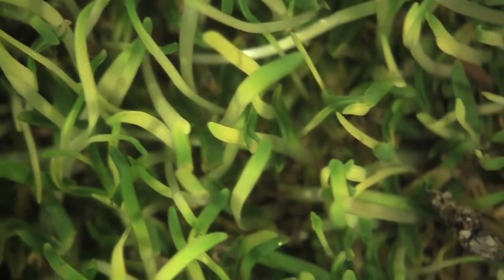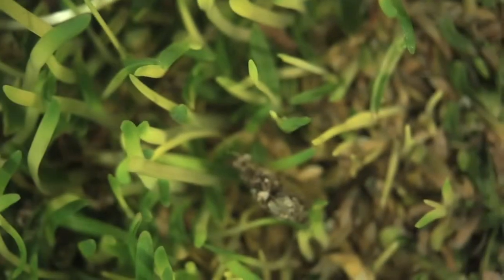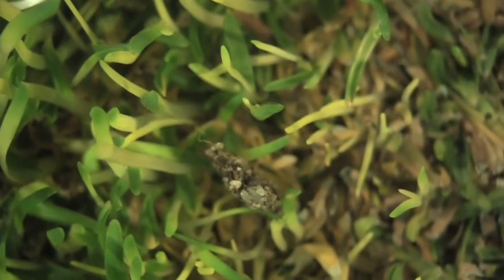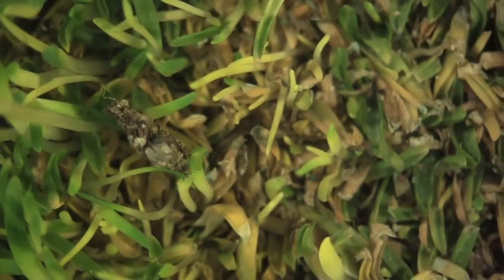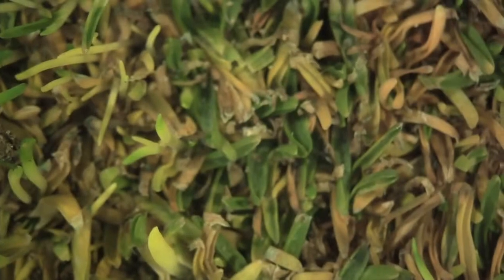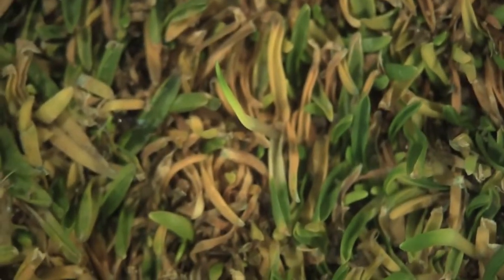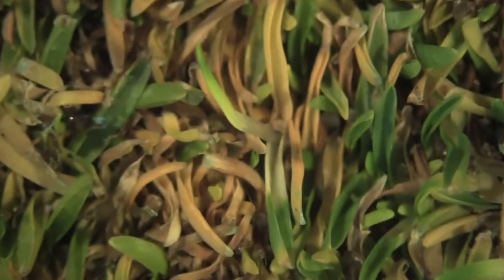Using the dissecting microscope to look at the normal plants and then scanning over to the stressed plants, you can see there's quite a difference in appearance. As we look closer and scan around the samples, there are a few interesting plants — some that are typical and some that are a little different.